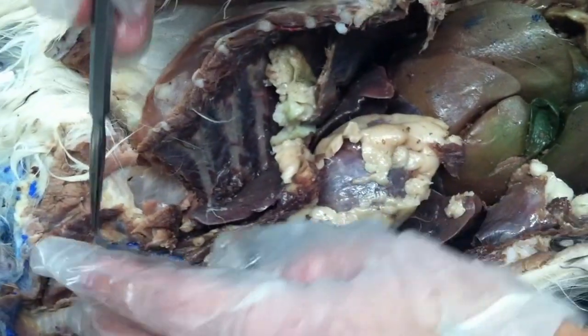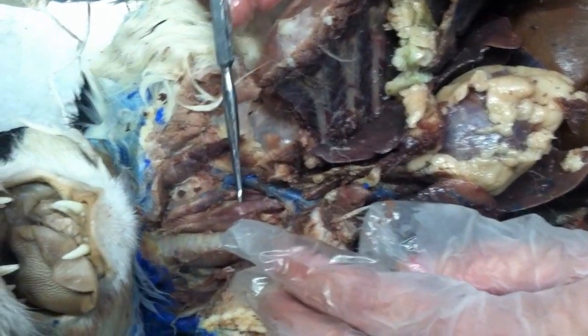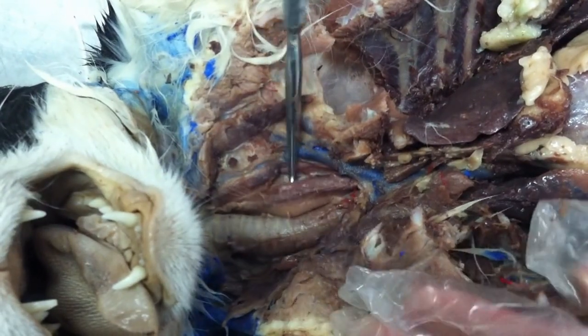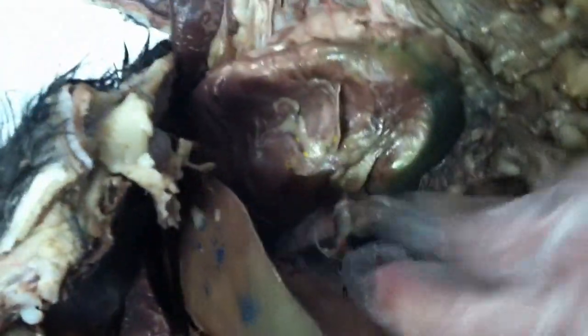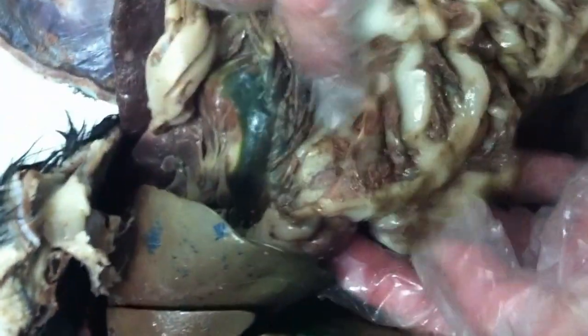And now the esophagus is next, sort of to the back, to the trachea, right? That's the esophagus? Yes, yeah. Okay, now the stomach. And then it goes to the stomach. It's here. Yeah, that's the stomach. Right? And then we follow it to the other end.